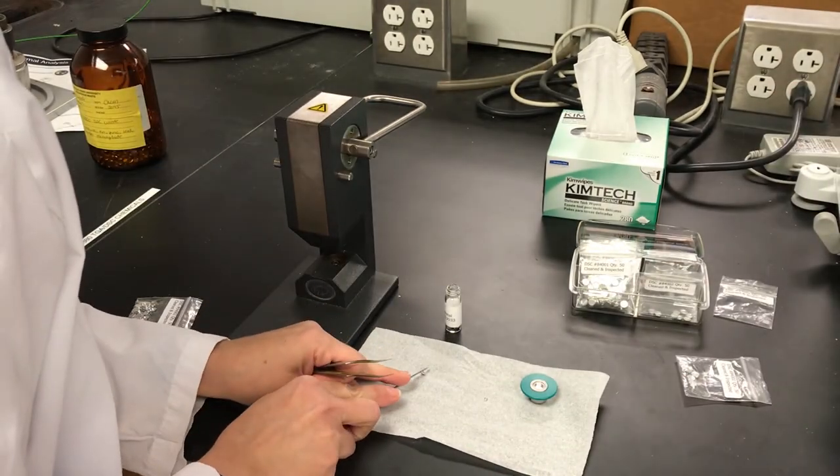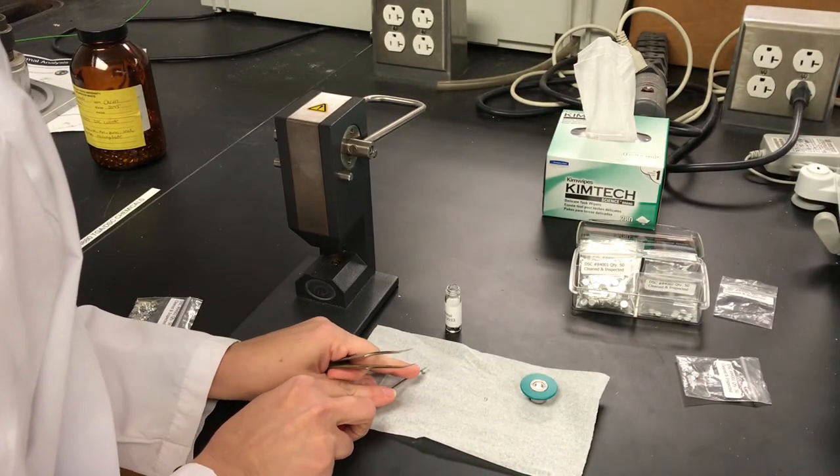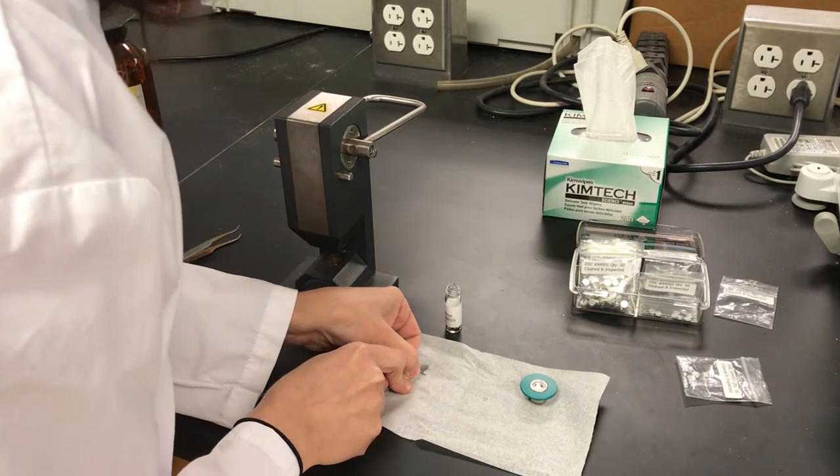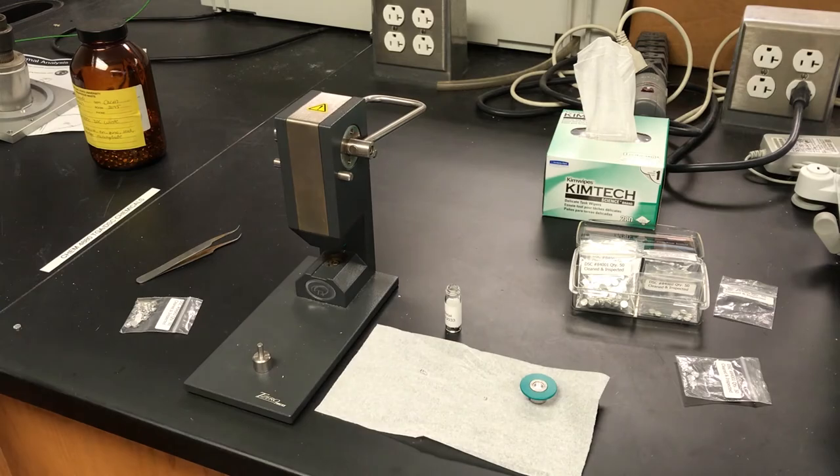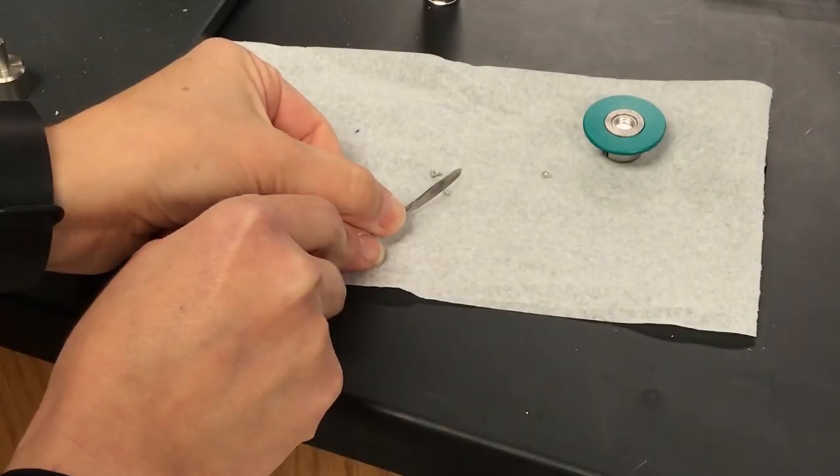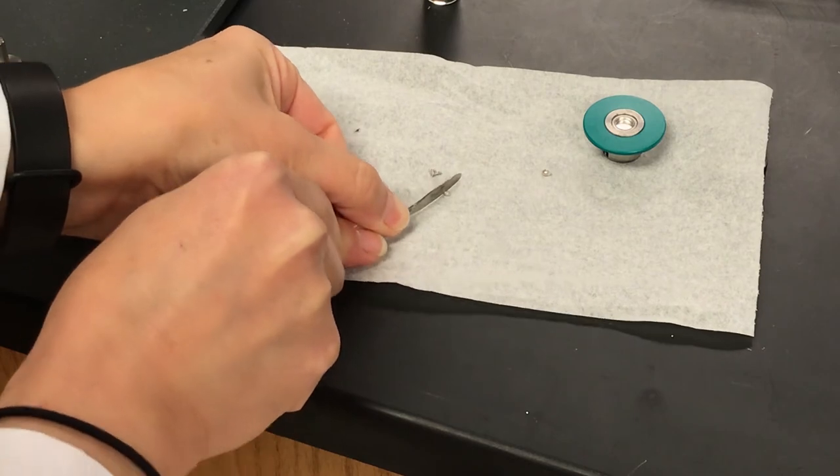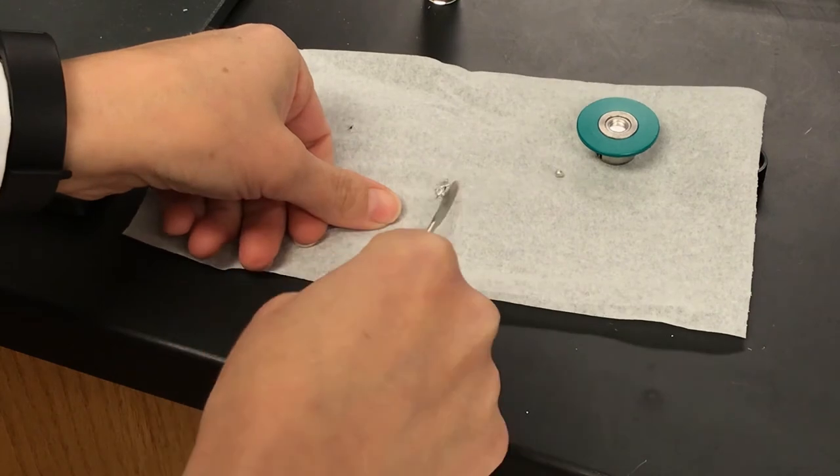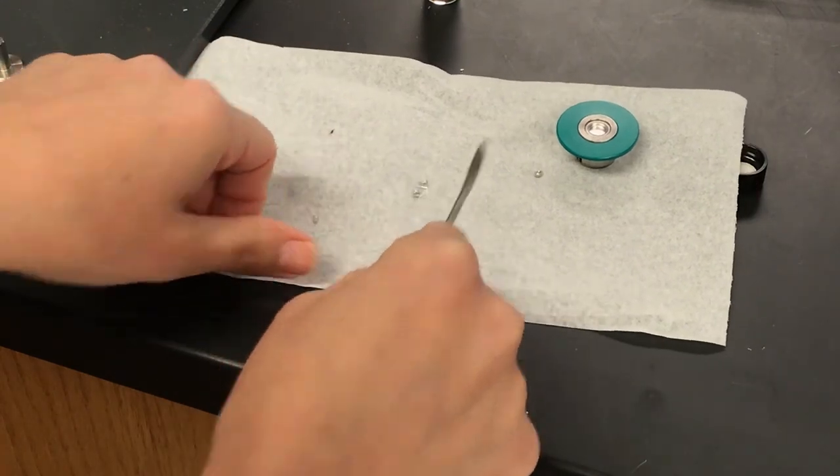Take your spatula. It's very soft. Just break it like that. Did you see that? You can break apart the indium just by using a spatula, pressing down. There you go. A couple of pieces there.